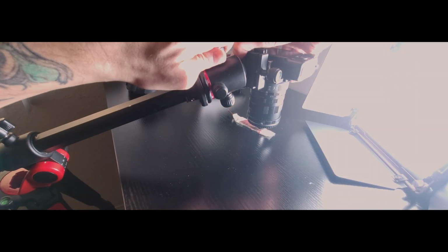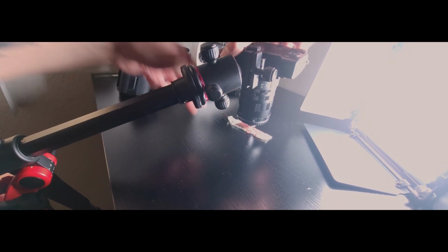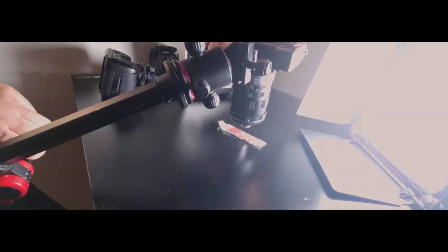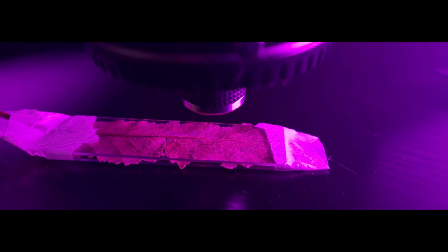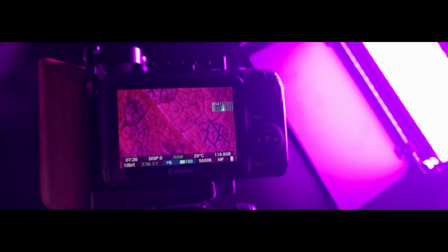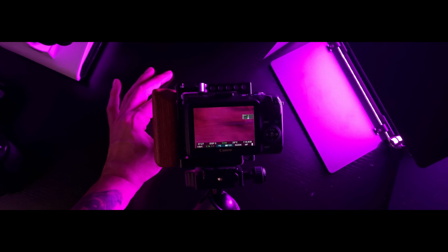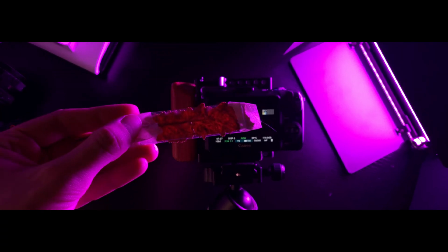Using a stable tripod can also help with stabilizing your focus. To help focusing, you can flatten objects by using two clear glasses pressing the object like a sandwich. And after finding the perfect focus, try not to move your camera. Instead, move your object. This way you can save time by avoiding adjusting your camera and tripod every time you change your composition.